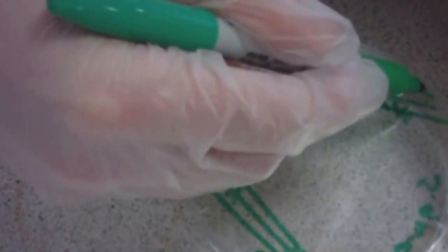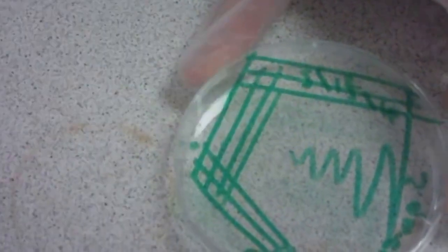After this streaking, you want to do a zig-zag streak into the middle of the plate without touching any of the previous lines.